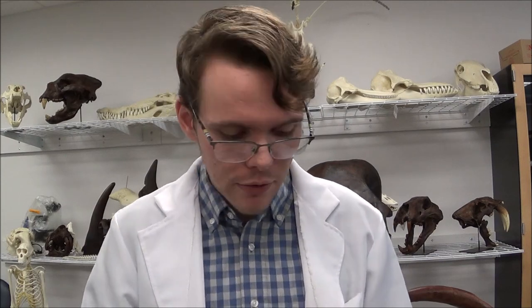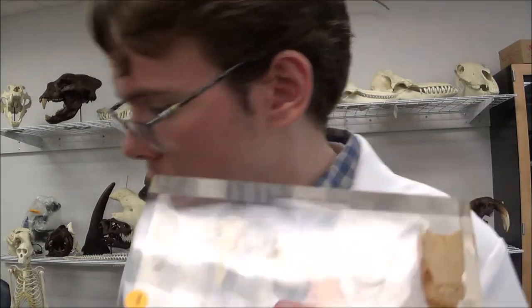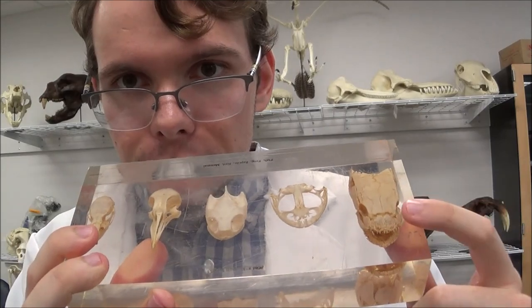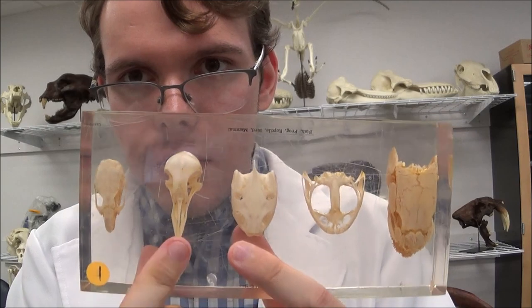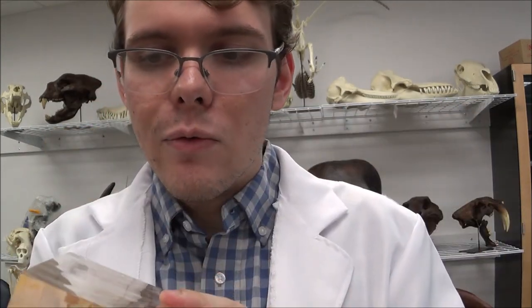Your first observation in class Mammalia is not all entirely in class Mammalia — we're just looking at the differences in skull and brain morphology across different vertebrate groups. We've already seen all of these vertebrates; I've seen them today, and you've seen them across the course of several weeks. What we have here are a bony fish, a frog, a turtle, a bird — this is a pigeon — and a rabbit.